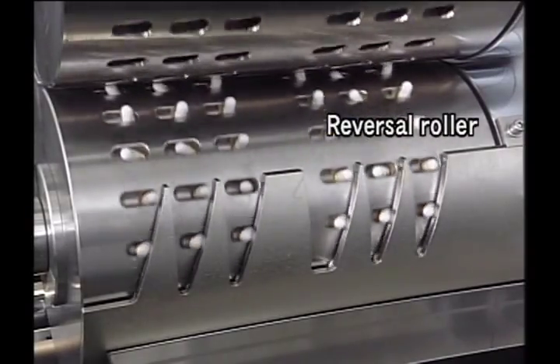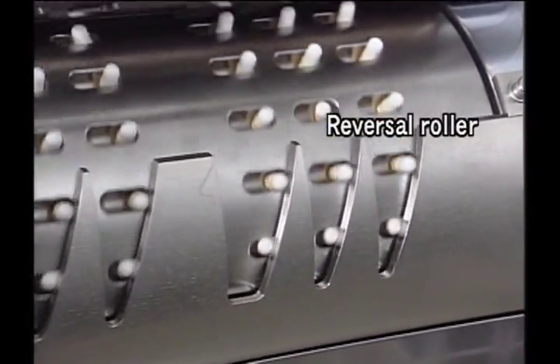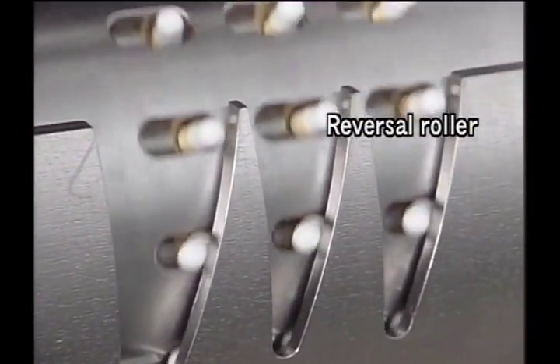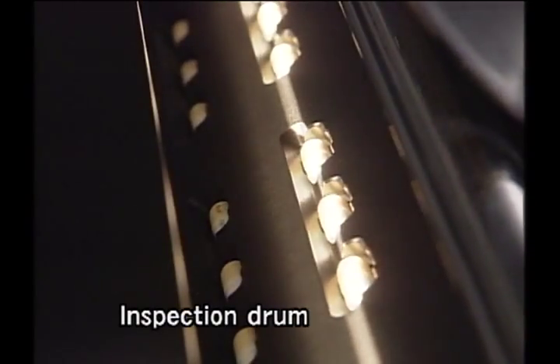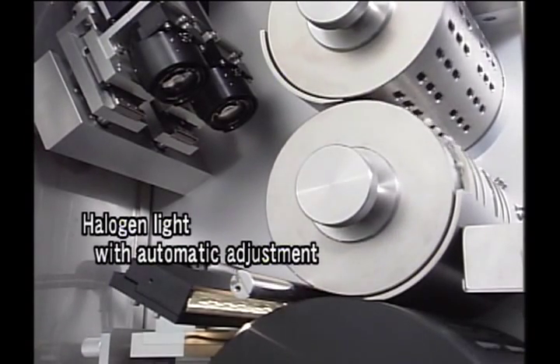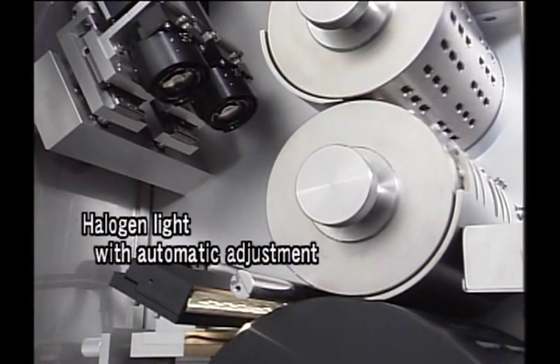After undergoing rectification, the capsules are moved to the inversion roller and transported to the inspection drum while being kept horizontal. Then appearance inspection is done using a halogen light that features automatic adjustment and a 1024-element CCD line sensor camera.